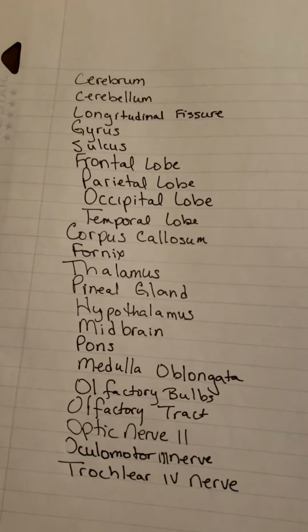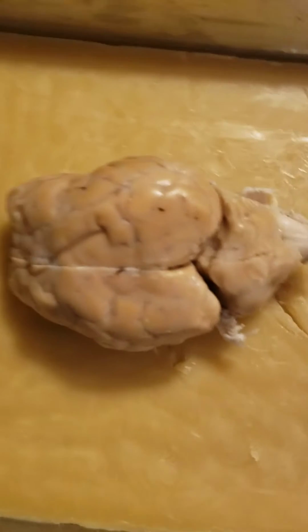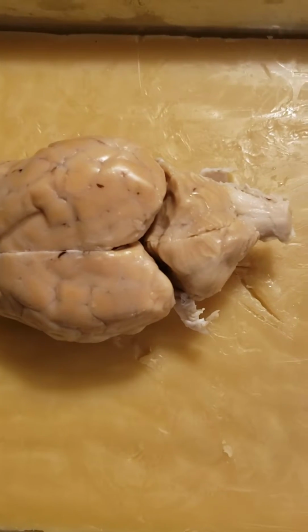All right, hopefully I'm recording. So this is my Sheep Brain Lab. I'm going to scroll down to show you my sheet. Good news, I'm recording. So there's my paper, and then over here is my sheep brain. So I'm going to move my paper closer so that I can see it, and then grab my pointer.